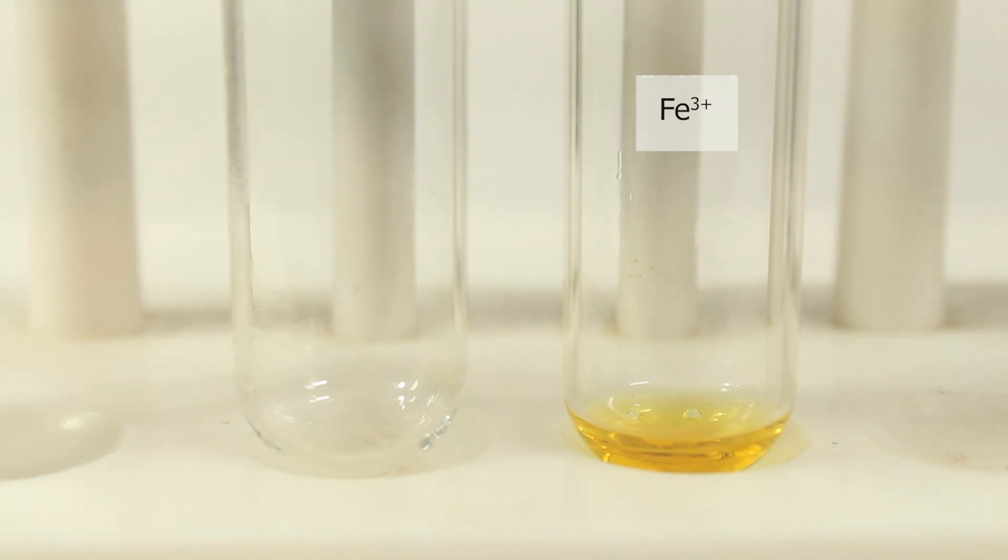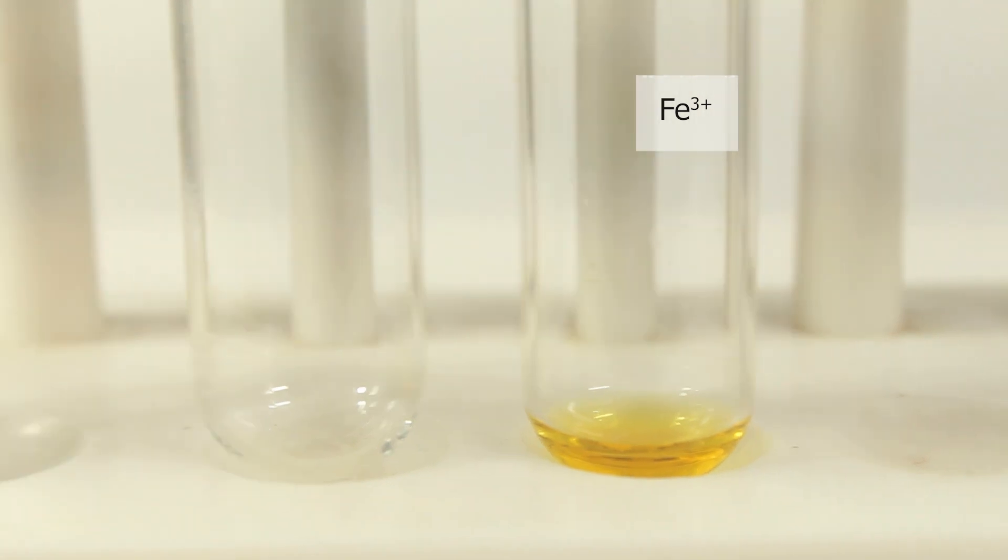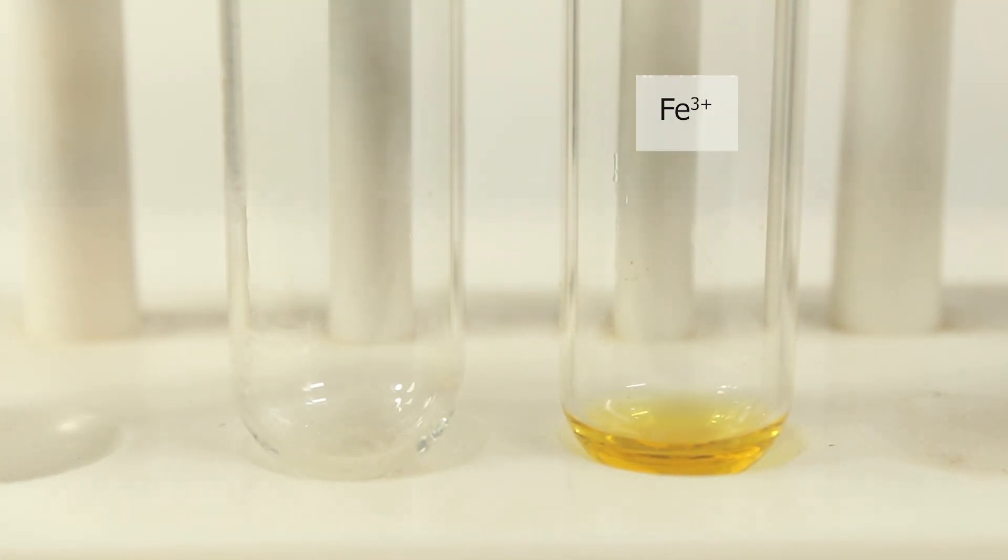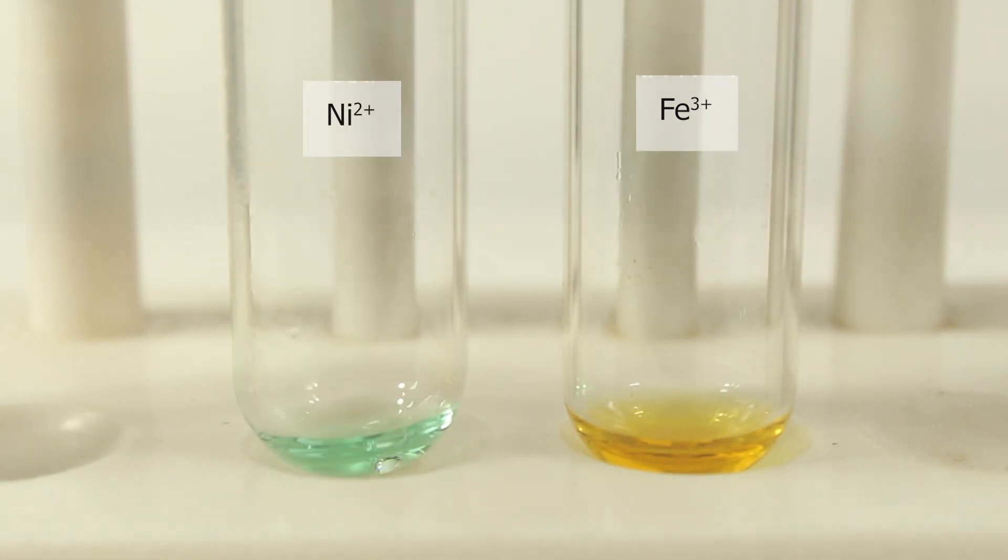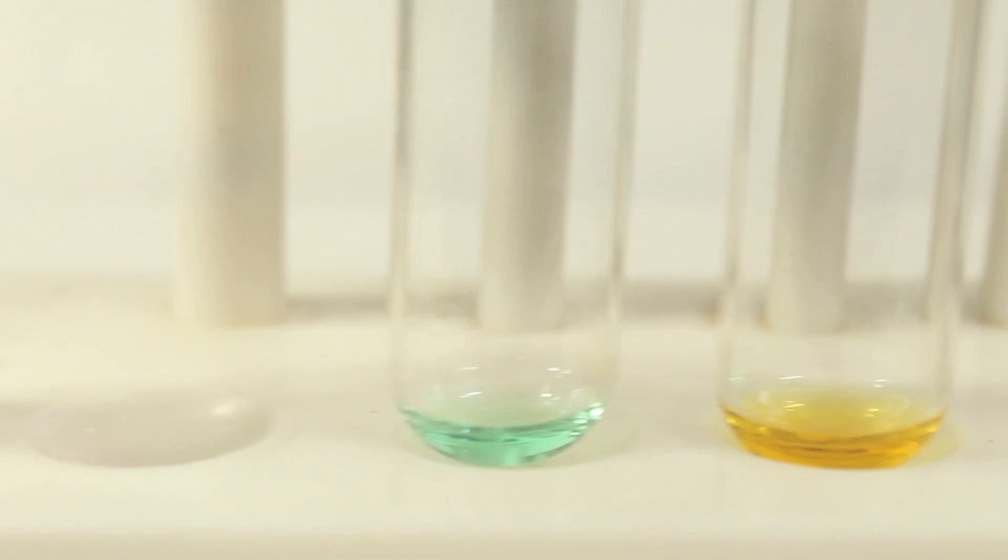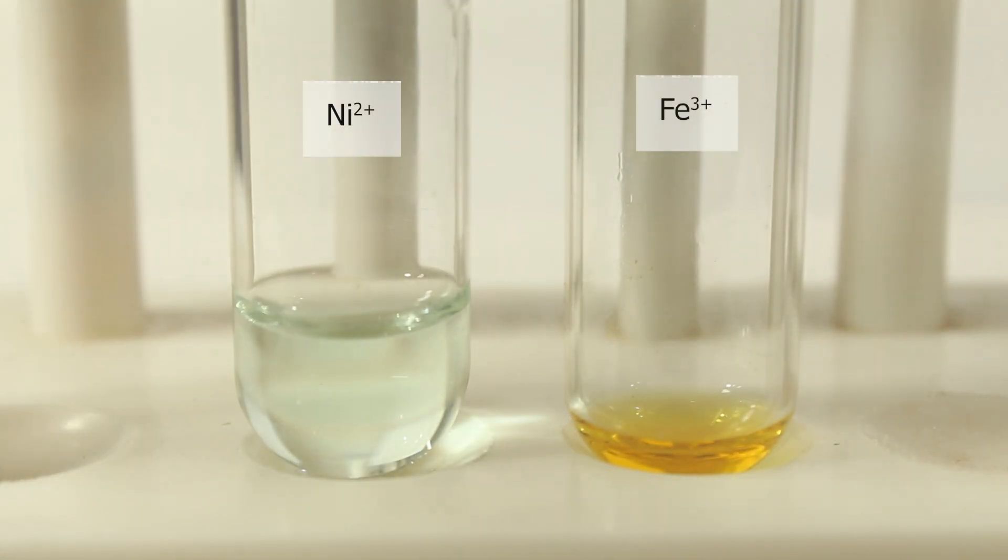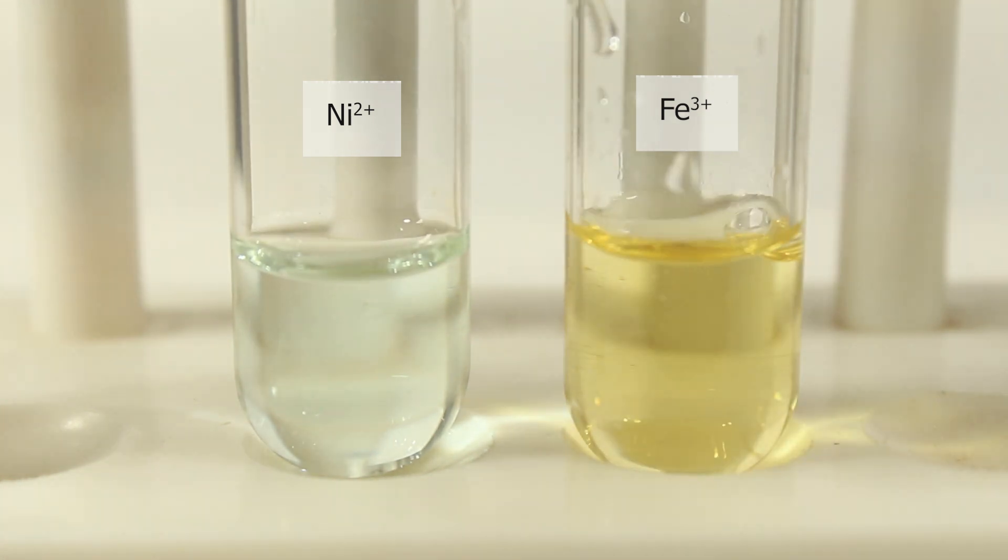I am using iron-3 chloride to demonstrate the test and as a control nickel-2 sulfate. Tests are pretty sensitive, so I can dilute my solution with distilled water about 20-50 times to appreciate the colors better.